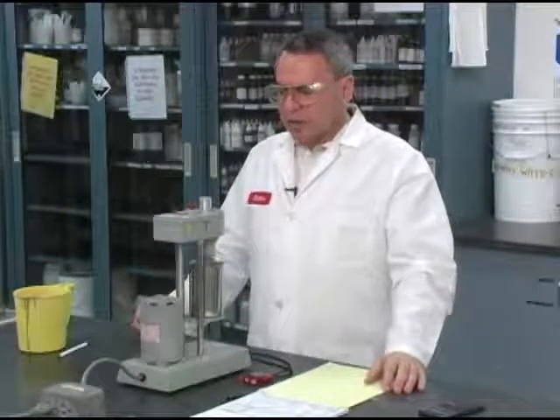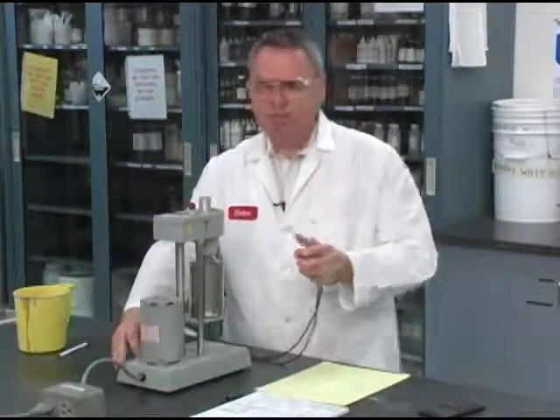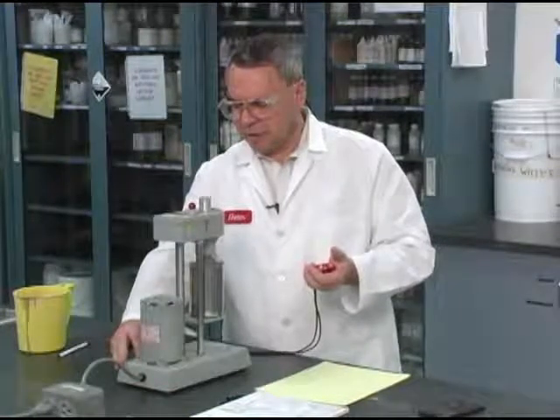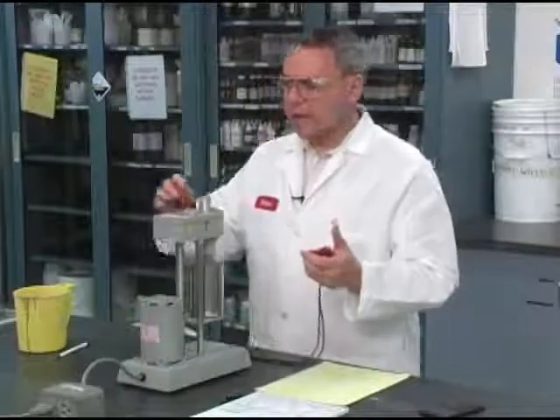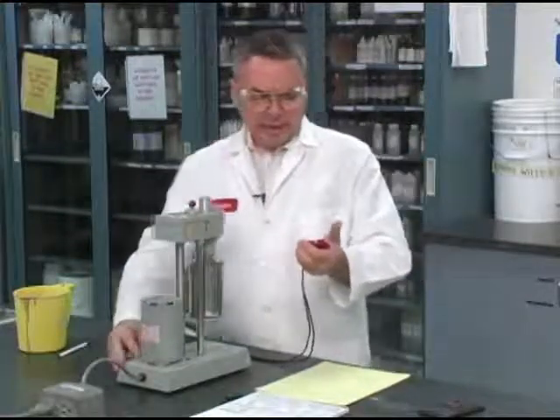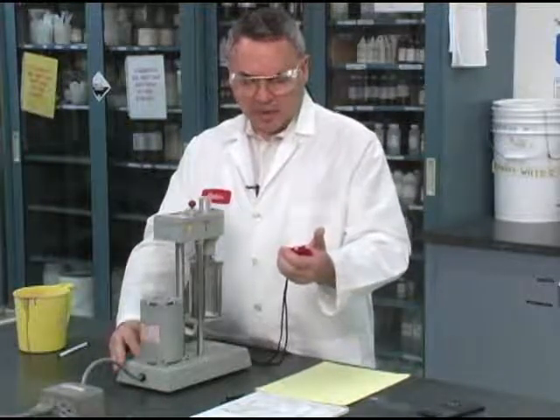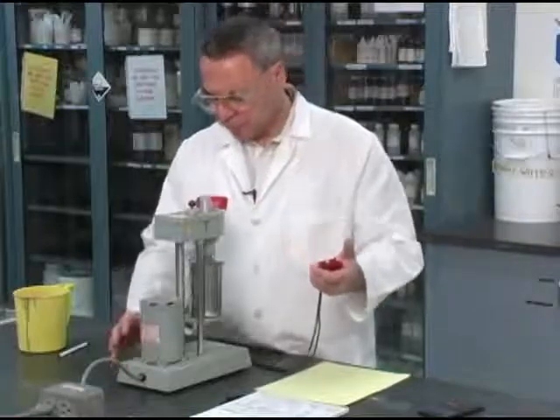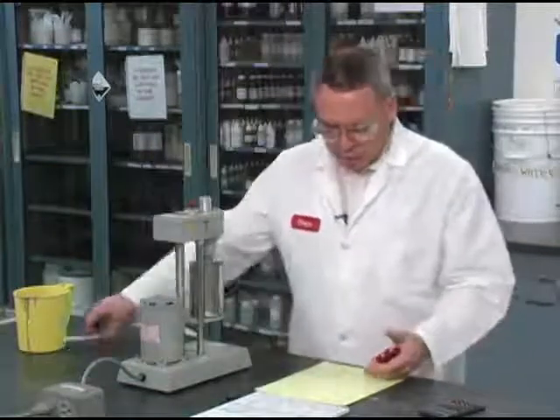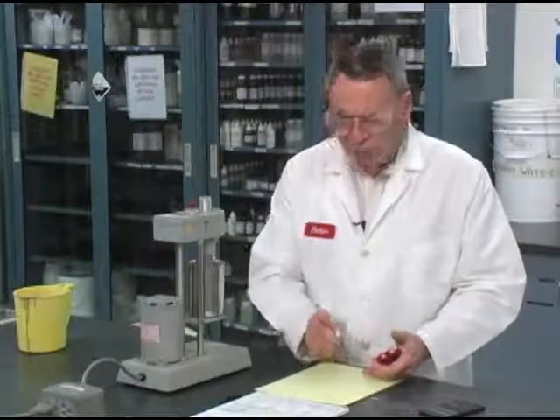I'm going to go ahead and stop this and count 10 seconds. So what I'm going to do is stop this, start counting 10 seconds, go to the middle gear, and make sure that I start at 3 RPM and watch for the maximum deflection. There we go. And I can tell you that the dial went all the way to 4, so that would be my 10-second gel, 4.